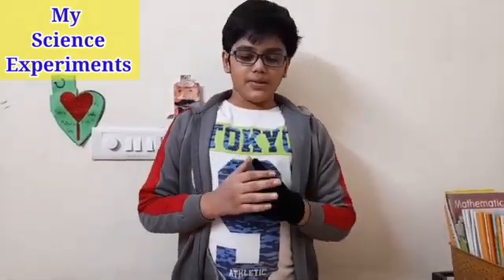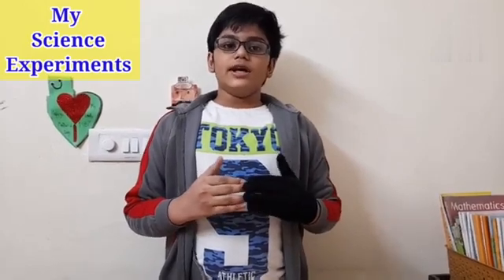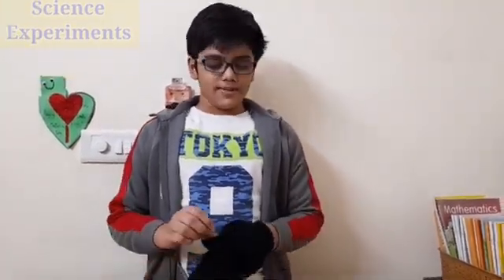So how will we test it? We have a match for it — we will light it and put it on the top of this bottle. What will happen is it will burn with a slight pop sound. This is a very unique feature of hydrogen gas: whenever it is burnt, it produces a pop sound. So let's do our experiment.